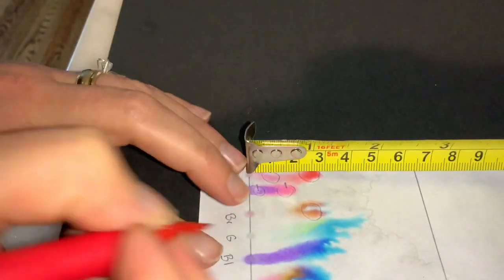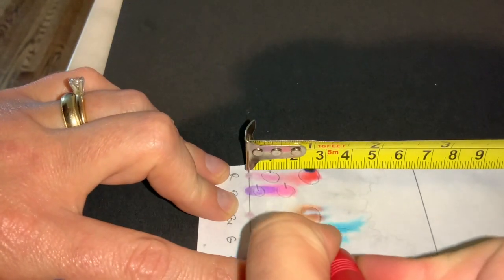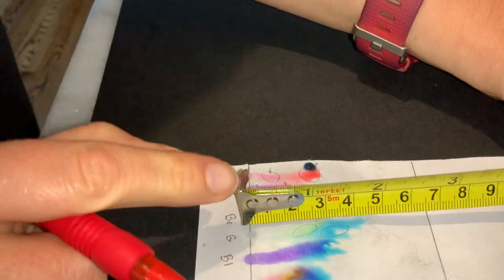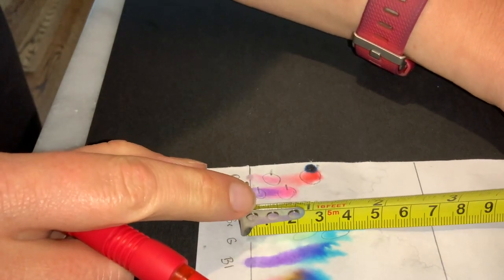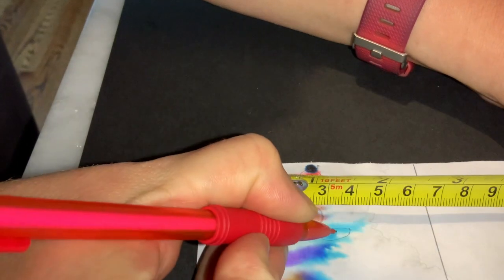My green, I've got a little bit of color here and then here. So we want to go ahead and measure both of those. Again, measure to the center.